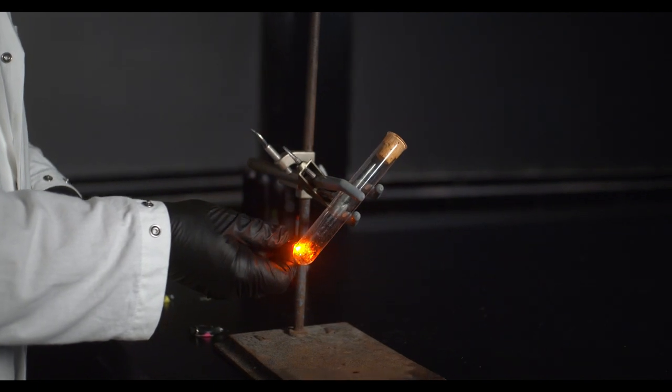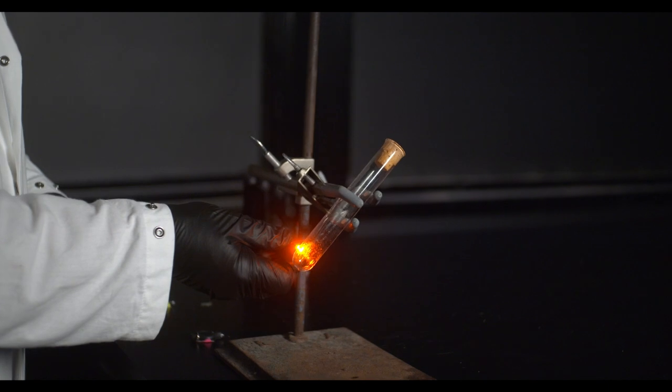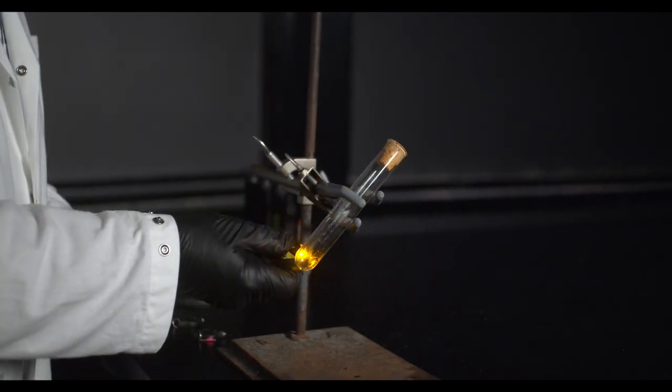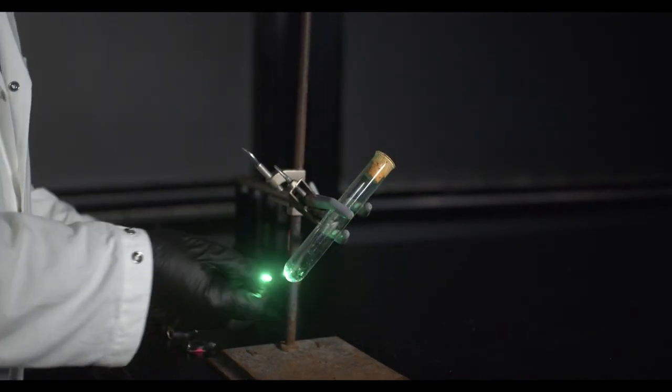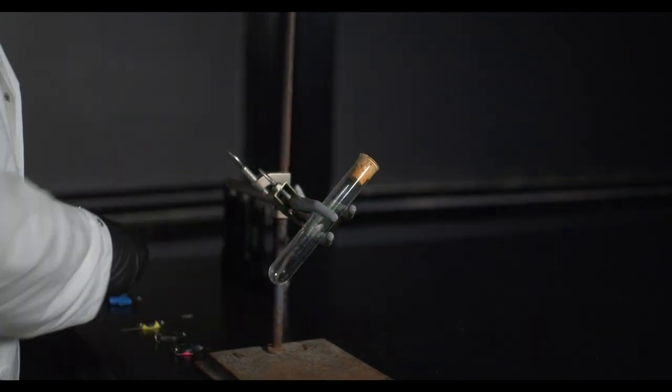Going to flex our LED collection. We've got orange light, shorter wavelength, higher energy, yellow light. Moving up the energy scale. We've got green light. Still no reaction.